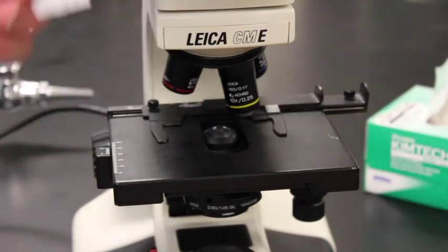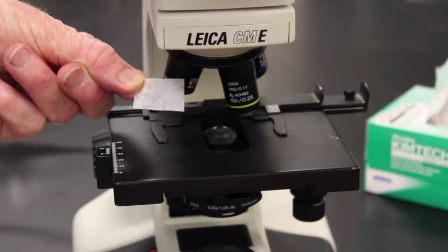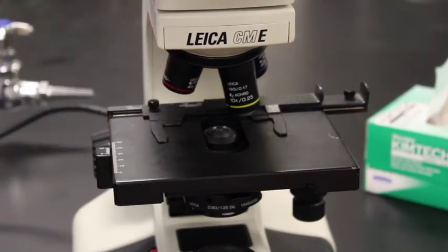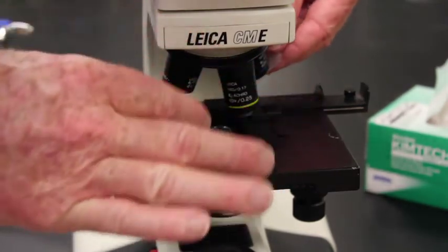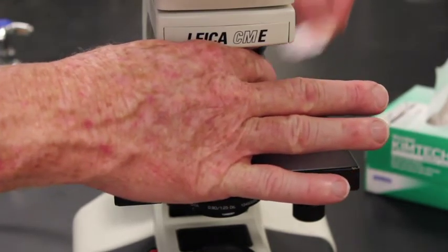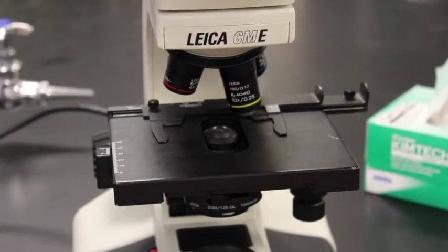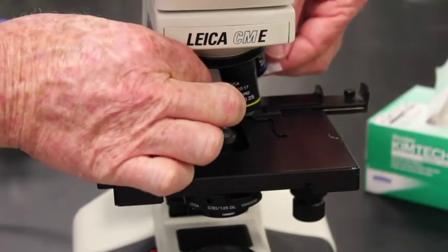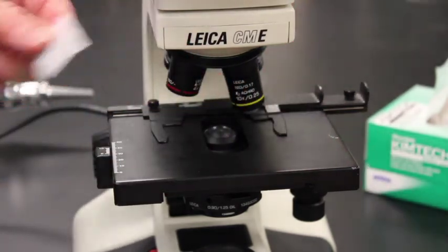If we look at the lens tissue on the 40x, it has a teeny bit of oil on there. Whoever used this scope last left a little bit of oil on that 40x objective. That should never be the case. I should never have any translucence from the 40x objective. So I'm going to wipe it again with a new piece, and you can see that's better. I'm going to take a third piece that has no translucence on it, and we will wipe it a third time, and then that objective is totally clean.